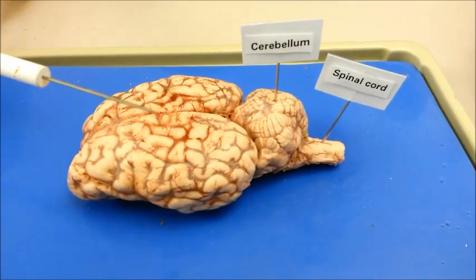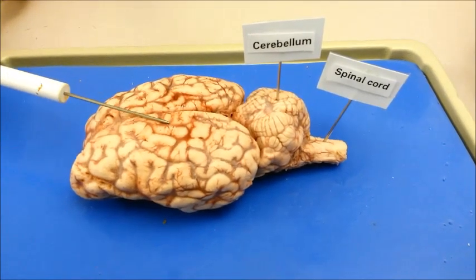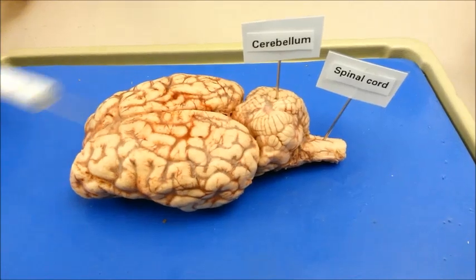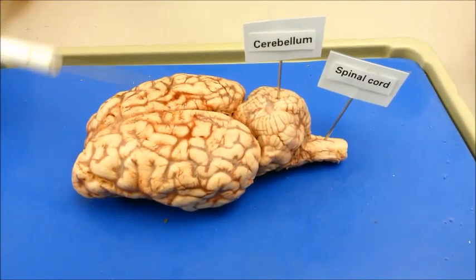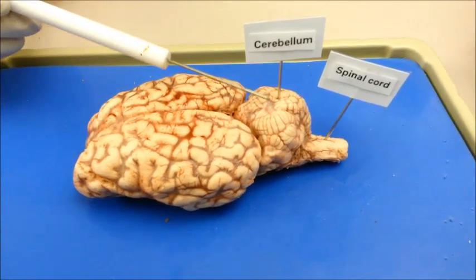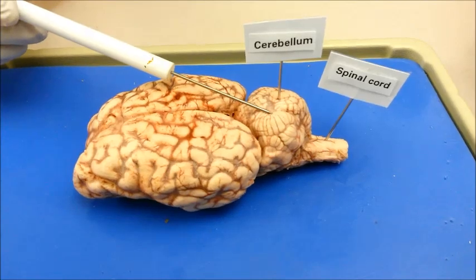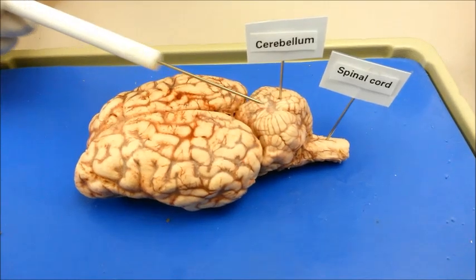The cerebrum, often referred to as the big brain, helps to determine an individual's personality, intelligence, and thought patterns. The cerebellum, which is also known as the little brain, assists with muscle coordination and balance.